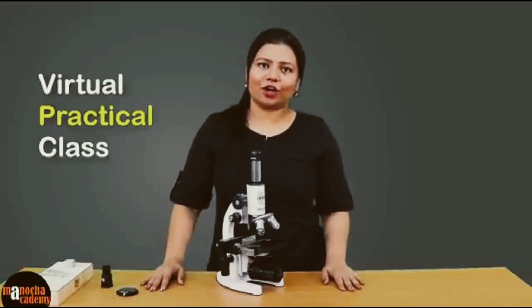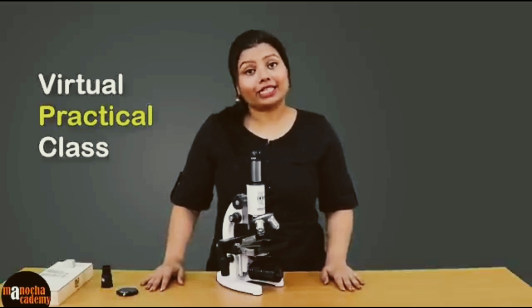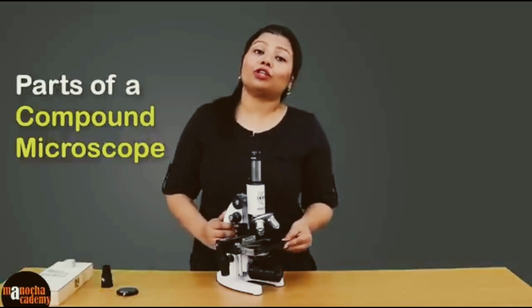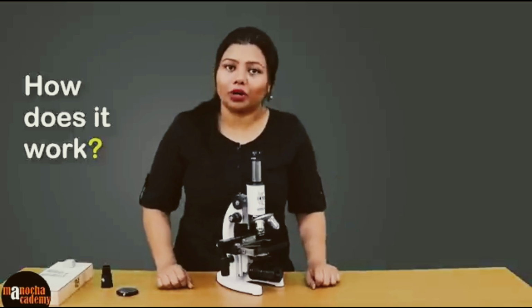Hello everyone, welcome to the virtual practical class of Manocha Academy. In today's class, we are going to see the different parts of a compound microscope, and we are also going to talk about how the different parts work.